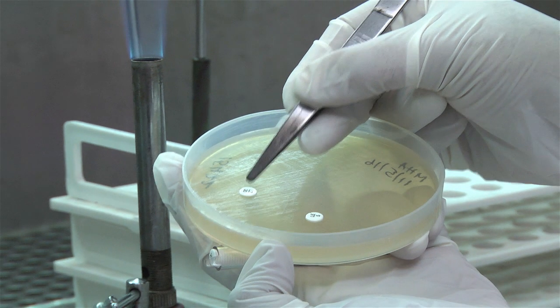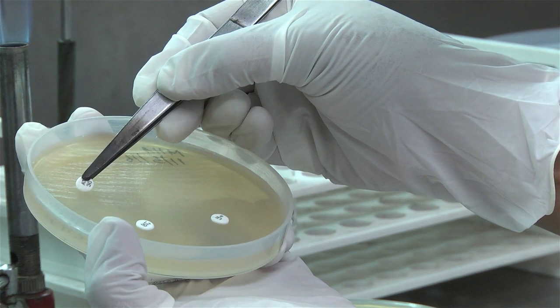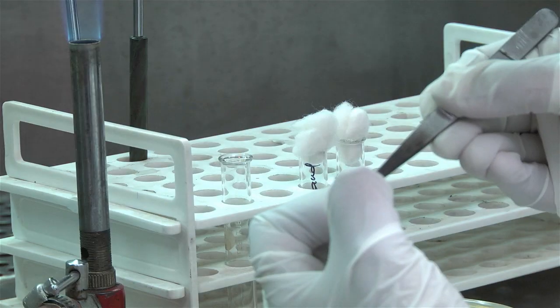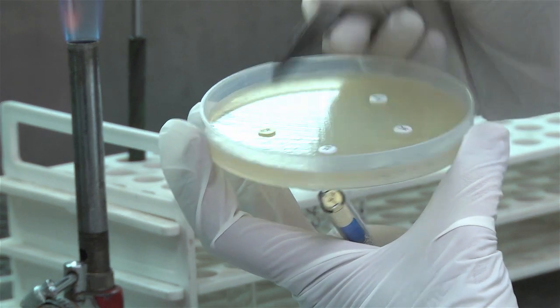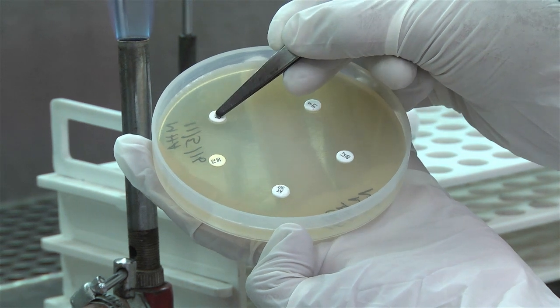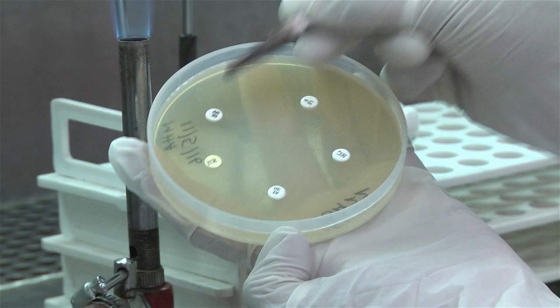The discs should be about 15 mm from the edge of the plate and no closer than about 25 mm from disc to disc. No more than 6 discs should be applied on a 90 mm Petri dish. For an inexperienced worker, the back of the plate can be marked with a pen indicating the position where the discs need to be placed. Each disc should be lightly pressed down to ensure contact with the agar and should not be moved once in place.